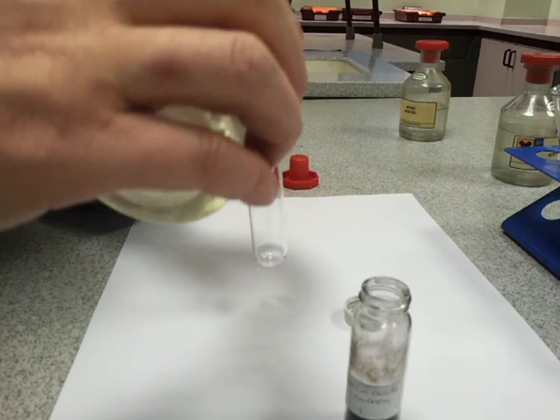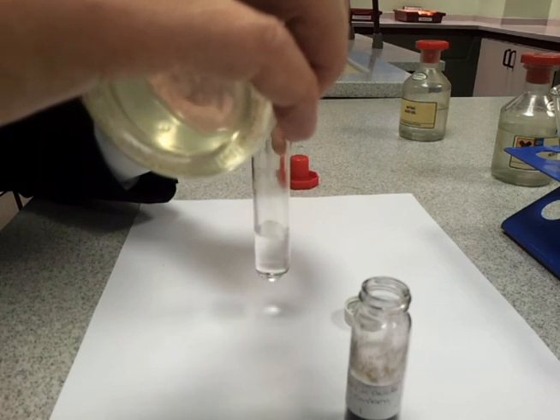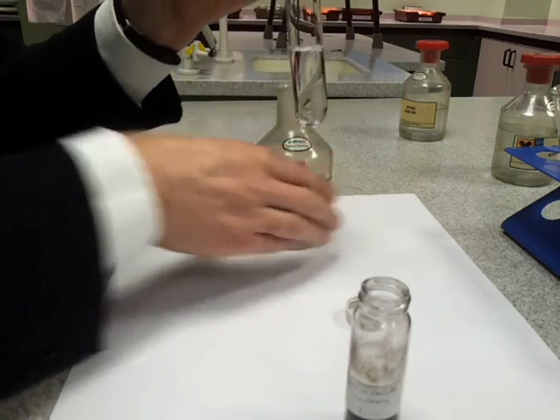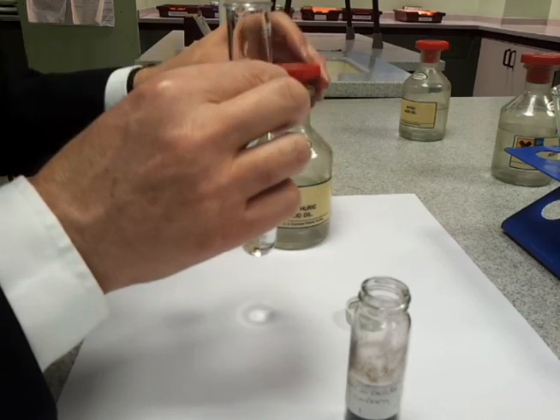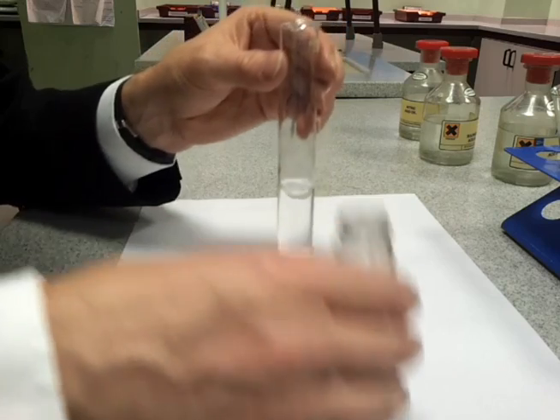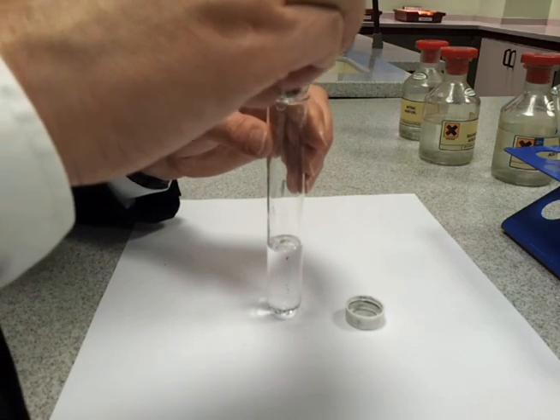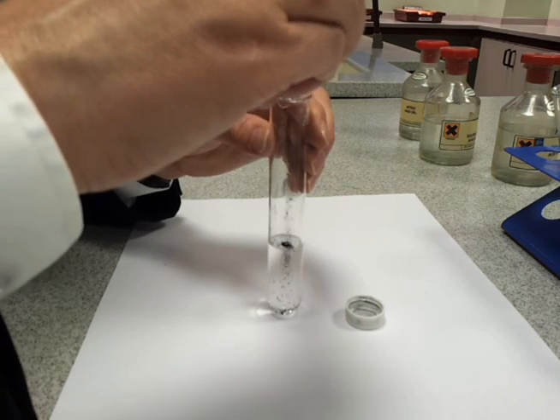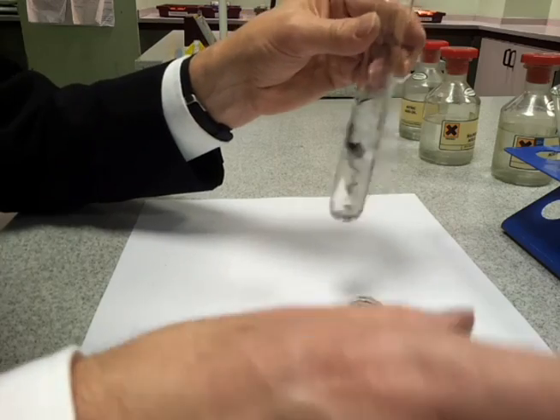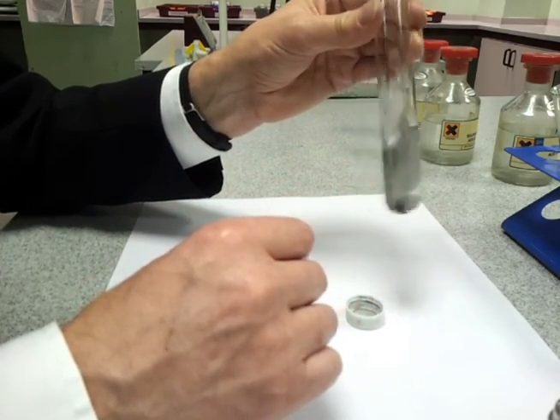Just pour a bit of acid into a boiling tube. And now I'll add a bit of the copper oxide powder to the sulfuric acid. So my reactants are sulfuric acid and copper oxide.